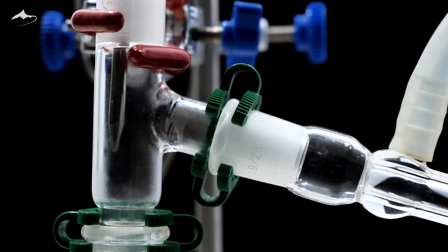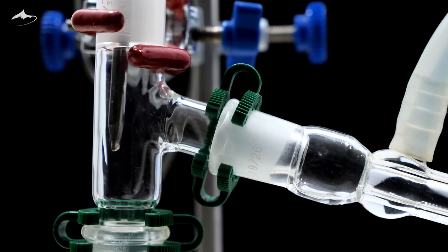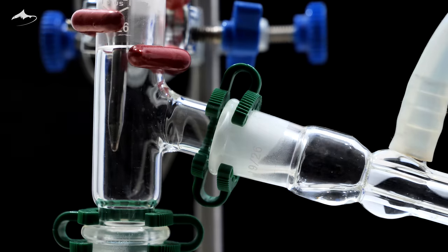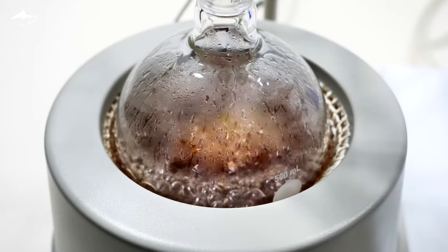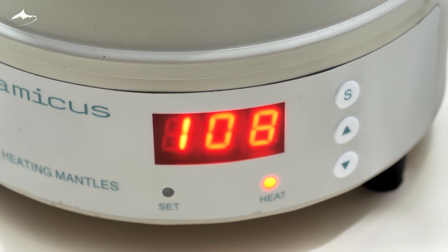In organic chemistry labs it is quite common to distill the reagents prior to the synthesis procedure, and in my case it was quite convenient. As you can see here, my bottle contained more than just butanol. It was boiling almost 10 degrees below its boiling point.